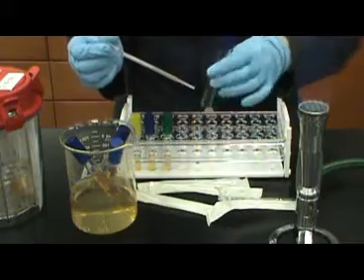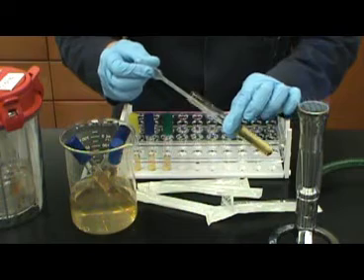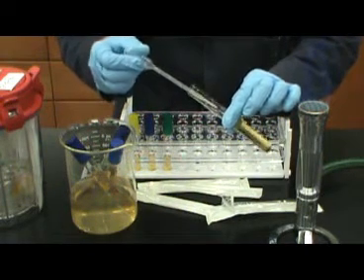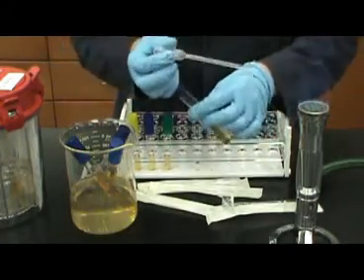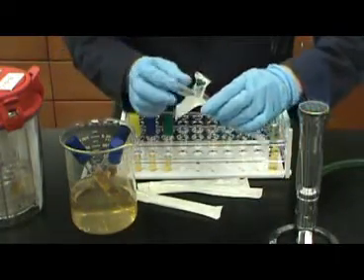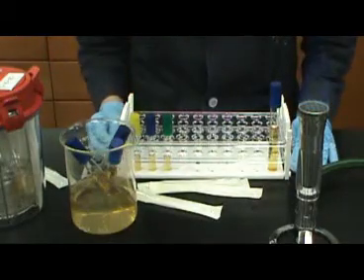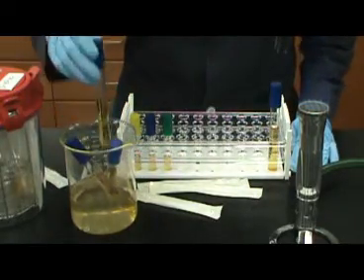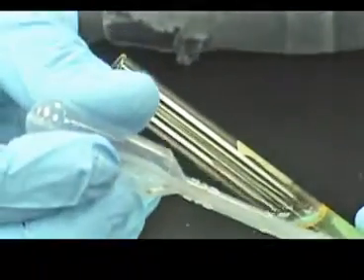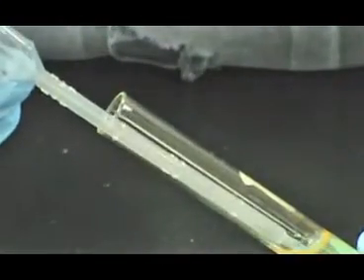Use a sterile transfer dropper to draw the media up. The droppers being used in this laboratory are graduated, so you know exactly how much of the culture is being drawn into the dropper. Carefully release some of the liquid culture into the top of the tube. Then slowly push the dropper down into the medium and continue pushing the culture down into the molten agar. Just before you reach air bubbles in the bottom of your dropper, you will want to remove the dropper from the media and finish the inoculation on the surface.